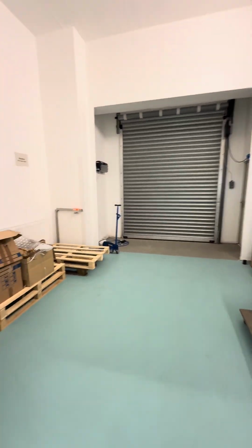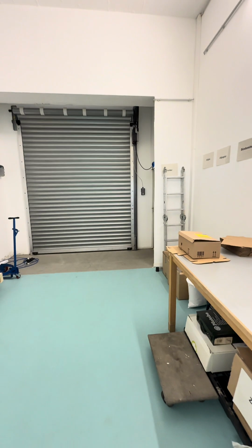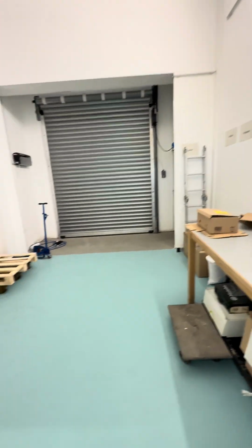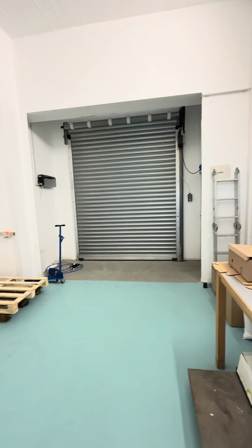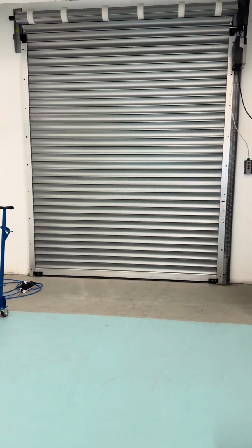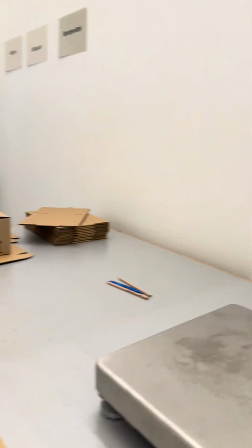In this room, we receive the raw material and all visual controls of the package and of the order take place. After this, the room is divided into different areas too, but just general checks of the package will be checked. Okay. So after this, the goods are going to the quarantine.